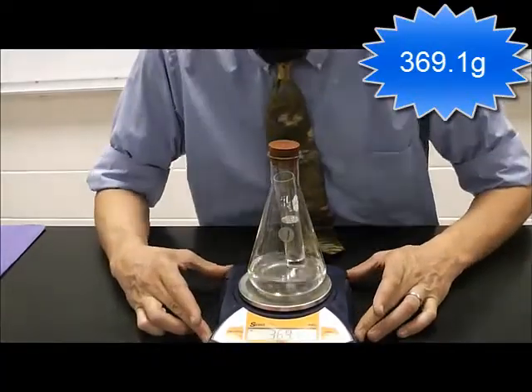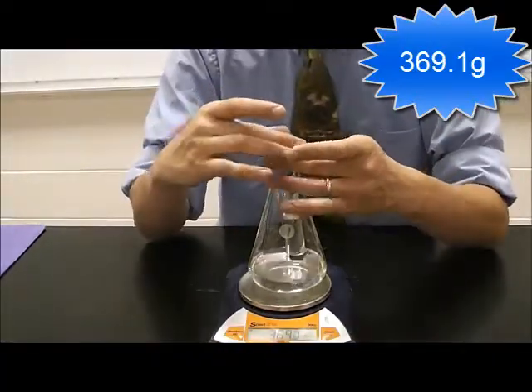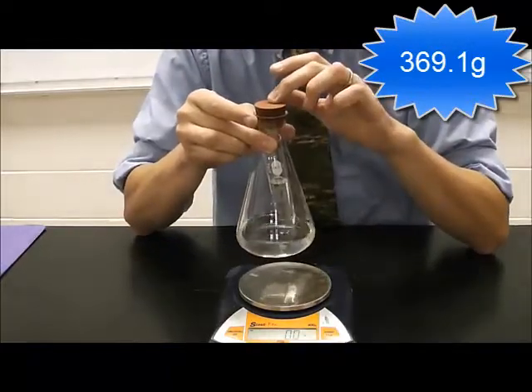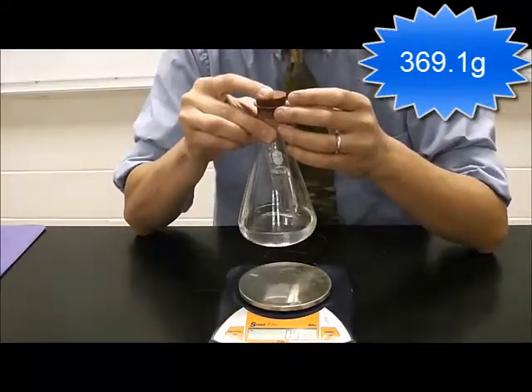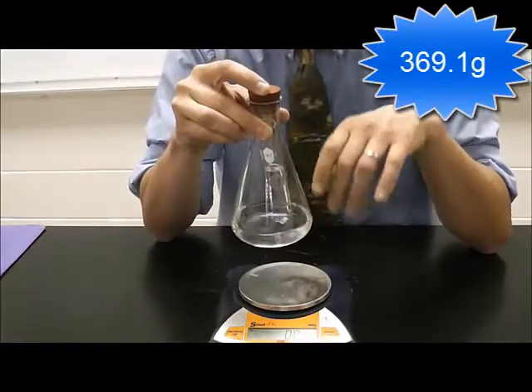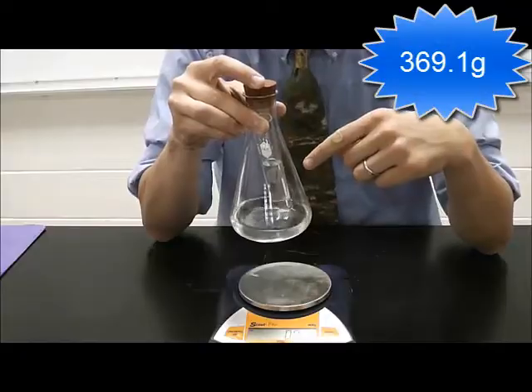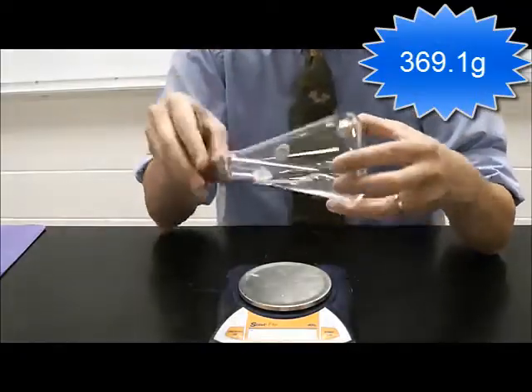Now, in order to get this reaction to occur, I've placed the stopper on the flask. That way, if there's any gases created, it won't allow them to get out. Also, in order to get these two solutions to actually mix, I have to flip it upside down. So I'm going to flip it upside down.